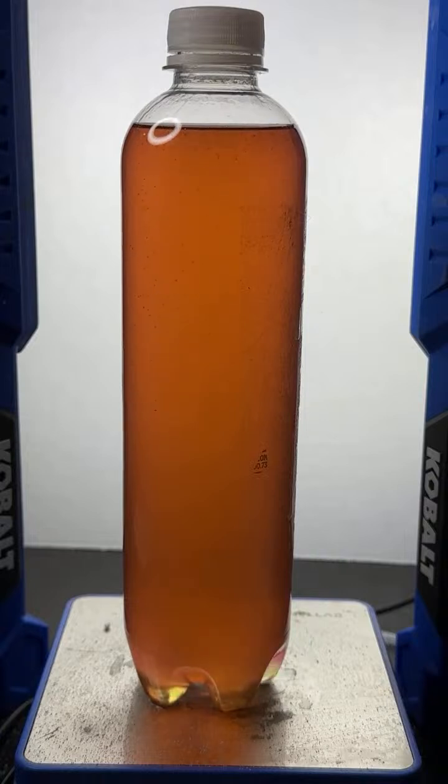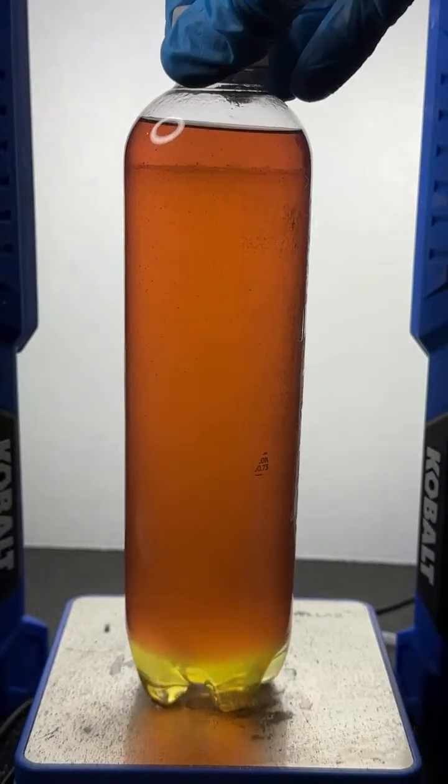All right, once that emulsion alcohol interface starts to form, we'll zero in on it and check it out a little better. I can see it right there. Let's see if it looks kind of cloudy.